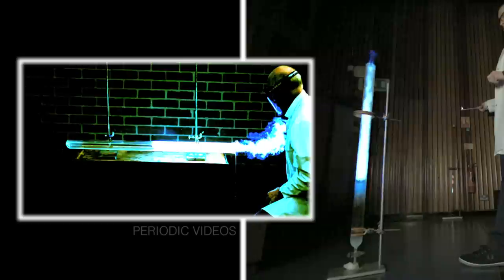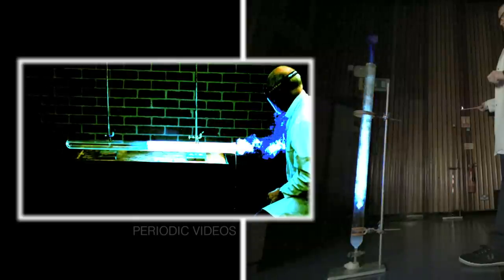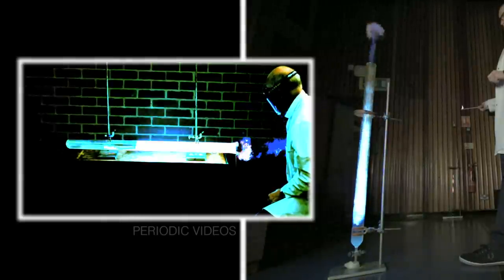Now, up till now, we had assumed, and it may be the right explanation, that the experiment produces a shockwave that hits the bottom of the test tube or the big tube and comes back again. So the flame going this way meets the shockwave coming back, which stops it for a minute, like being thumped.